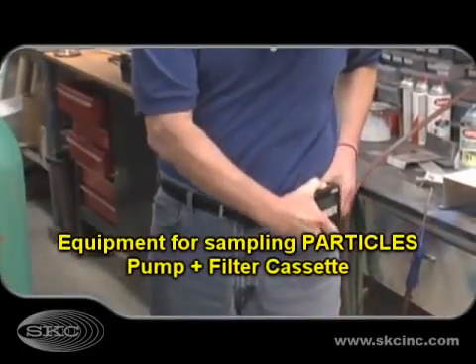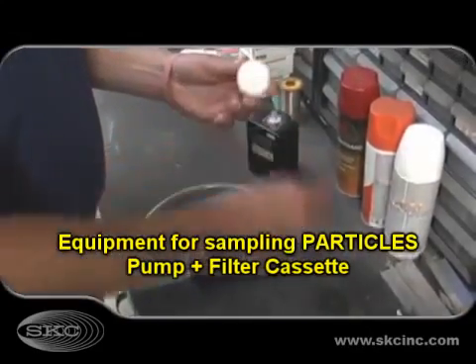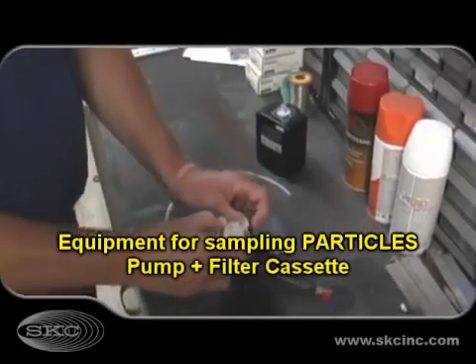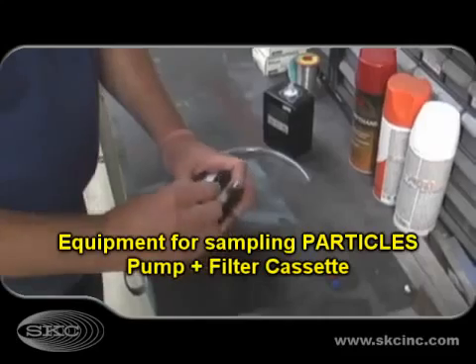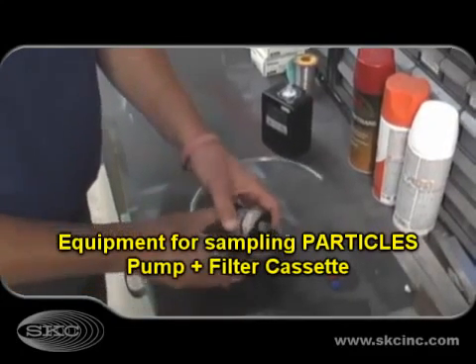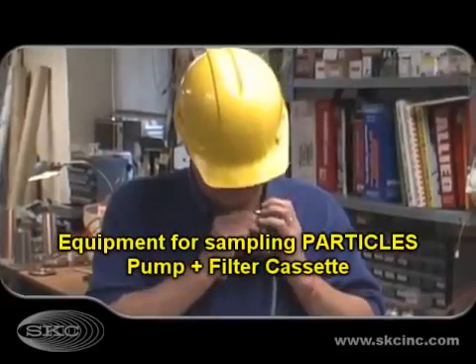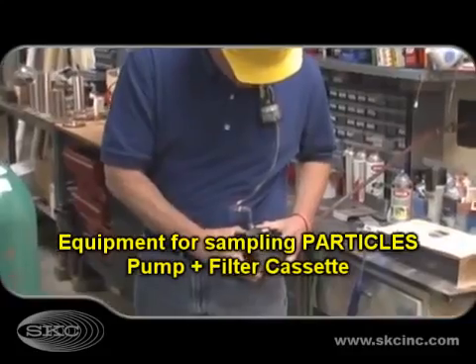To sample particles such as dust, mists, fumes, and smoke, filters in cassettes are the typical sample media. The cassette is prepared and loaded into a convenient holder that secures the cassette. The holder can be clipped in the worker's breathing zone. The sample media is then attached using connecting tubing to a pump that has been calibrated to the recommended flow rate.